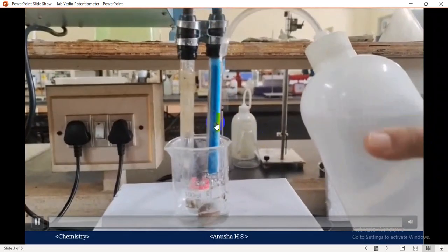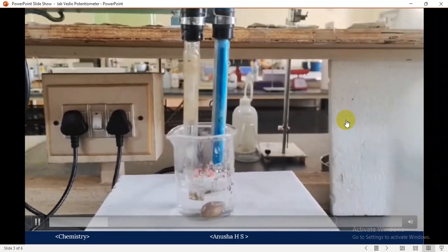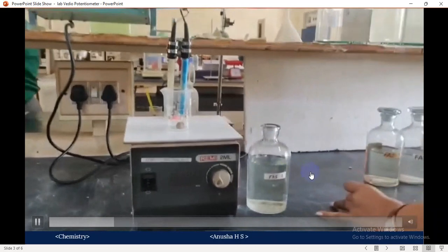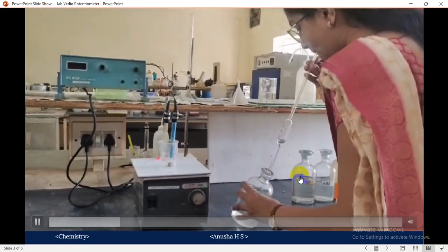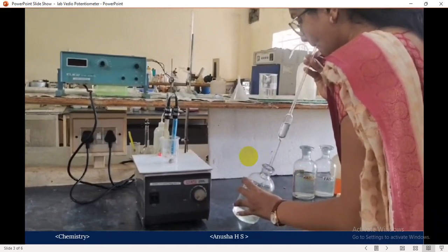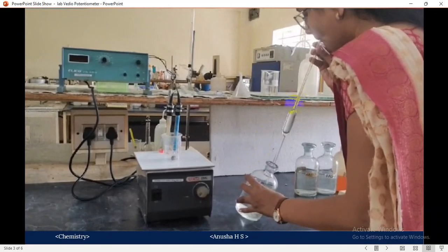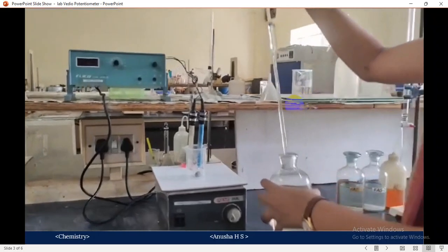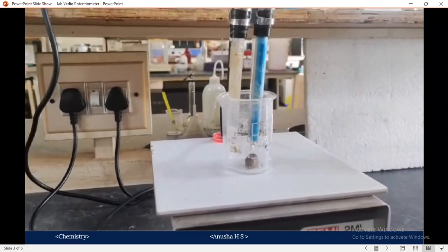So this is the overall setup for the potentiometric experiment, the chemicals required and glass apparatus. First we have to wash the glass electrodes with distilled water. After that, take the FAS solution, ferrous ammonium sulphate solution. Here there are three different concentrations of the FAS solution. First I will take the FAS 1 bottle. We have to pipette out 50 cm cube, and since this is a 25 cm cube pipette, we pipette out twice. Now I pipette out 25 cm cube of FAS solution and add it to the beaker.